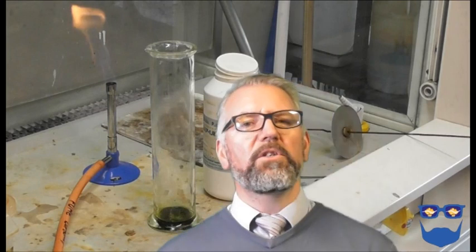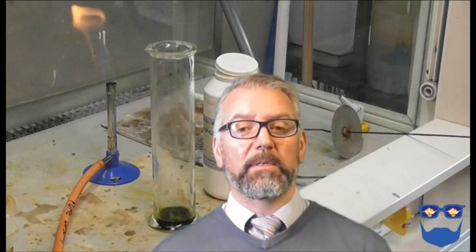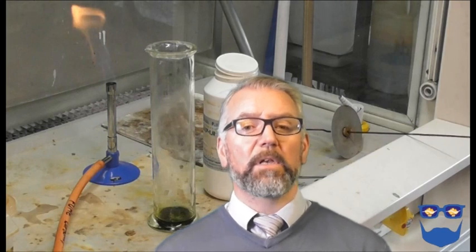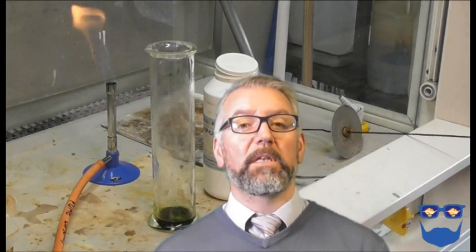Ask students why they think the experiment is carried out in a fume cupboard. This can lead on to the idea that burning sulfur in fuels can cause respiratory problems in humans.